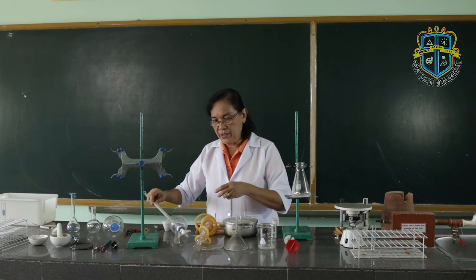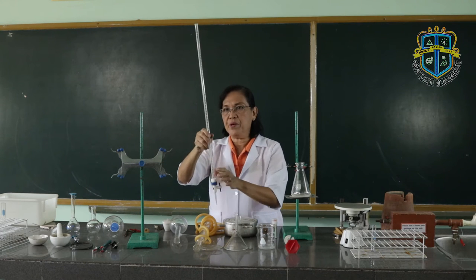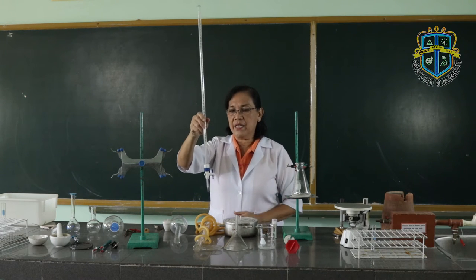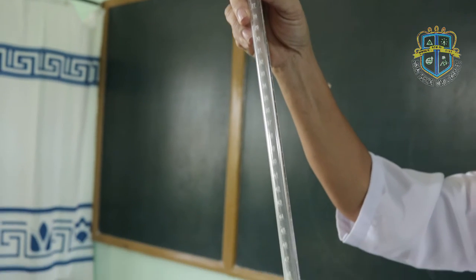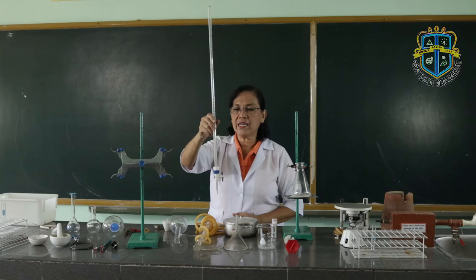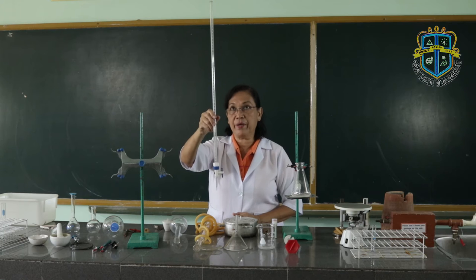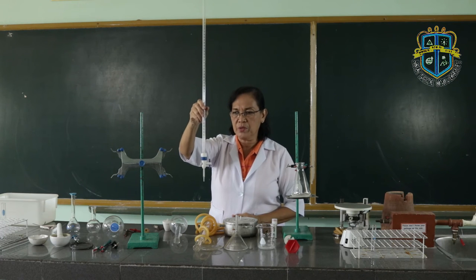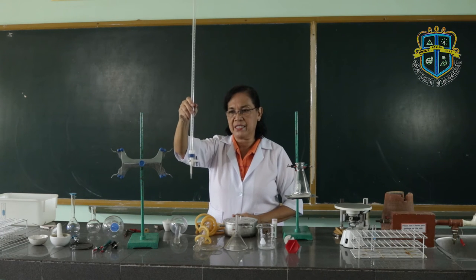Then this is what we call the burette. The burette is also used to measure an exact amount of liquids. Usually, it is used for titration purposes.